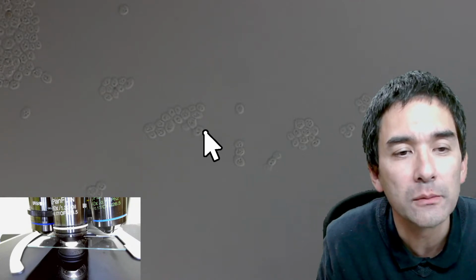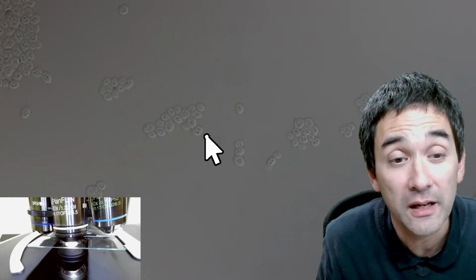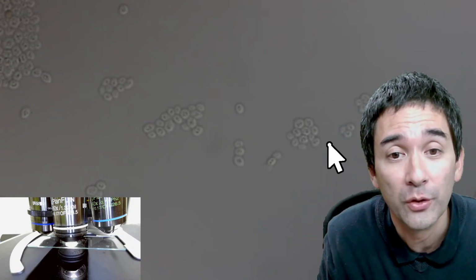Yep, and here are the cells. And yeah, the contrast is not so high. But you're going to see again that the structures inside the cell are visible. Okay, but again, two ways in which the cells have been processed. First of all, three ways actually. They have dried, they were heat fixed, and now they are in contact with the oil.